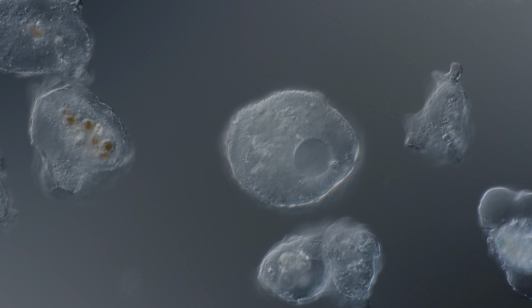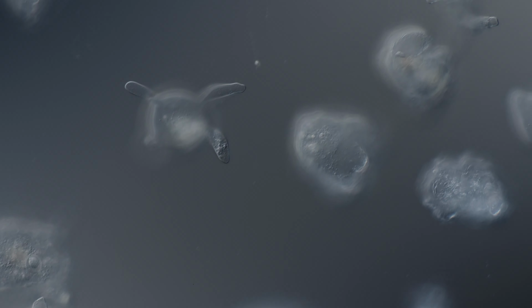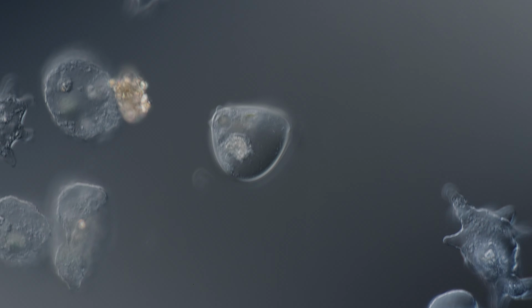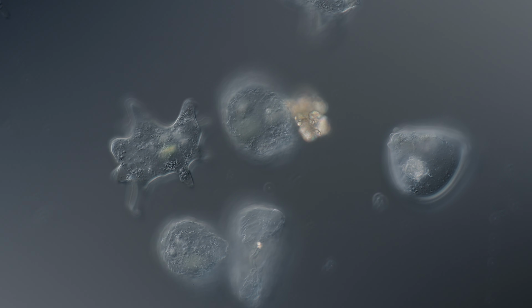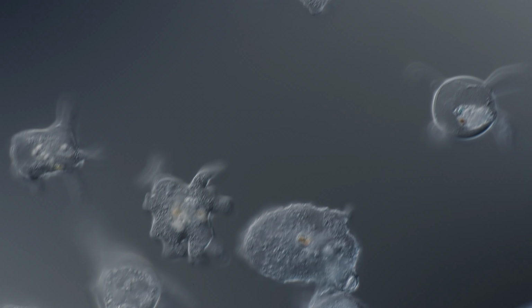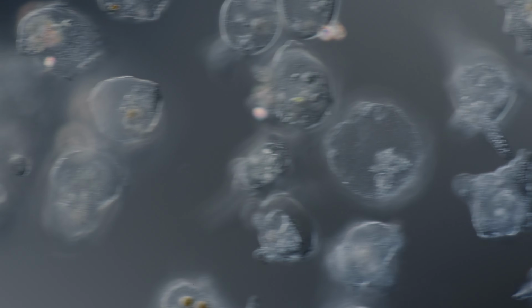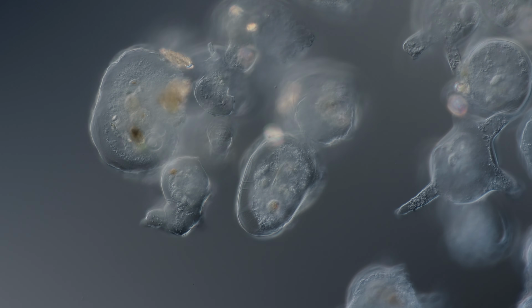So this one is going to be my batch for the next few days, I think. Tomorrow I'll take the globular ones to the upright for a deep investigation.